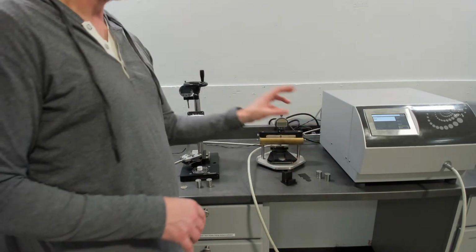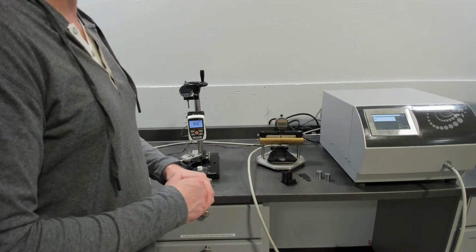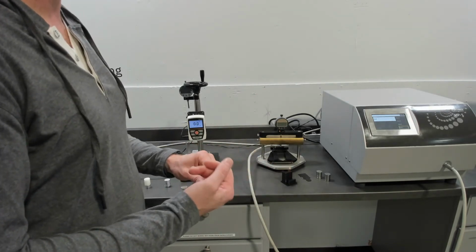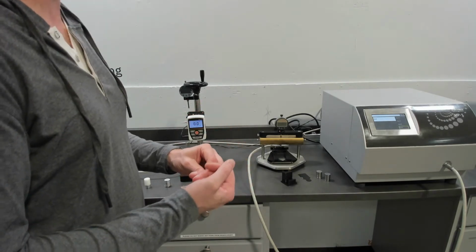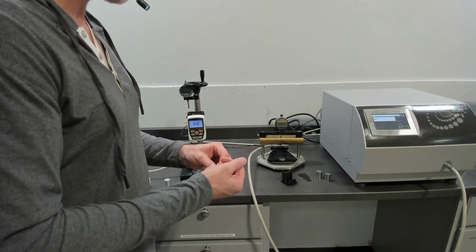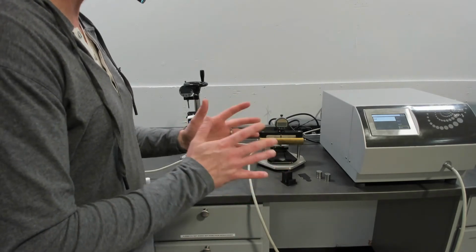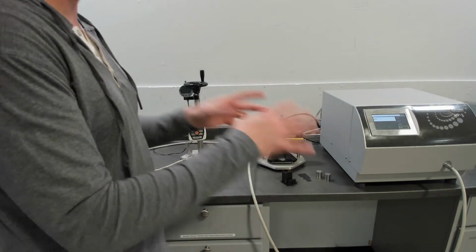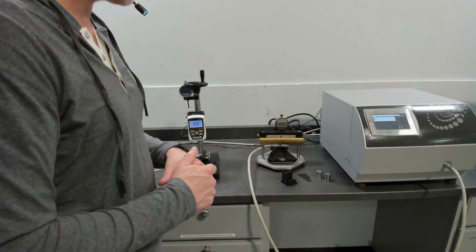But before I move on, what are the reasons we did that? Why is this a unique capability? First, the ability to measure thin films and adhesive type materials is quite complicated with the available methods on the market today. They're narrow in range and can be quite sensitive to variations, because with all those other methods you're typically measuring direct thermal conductivity, which can be sensitive to variations.